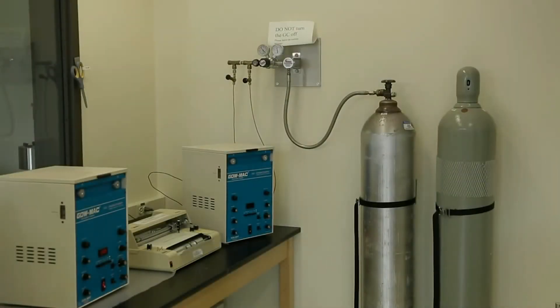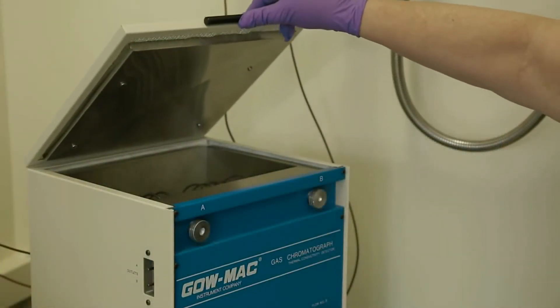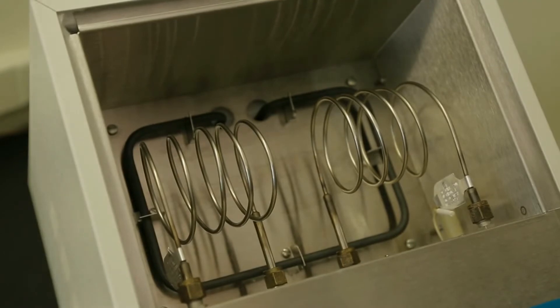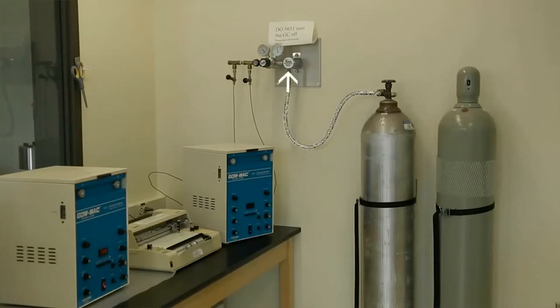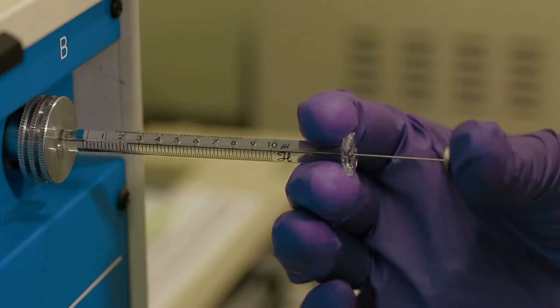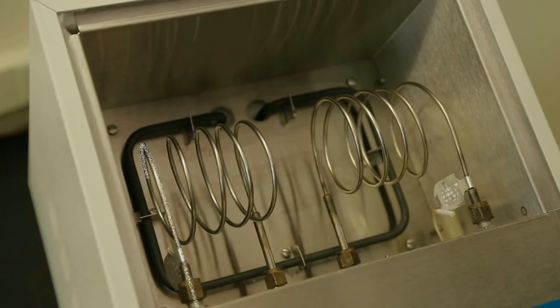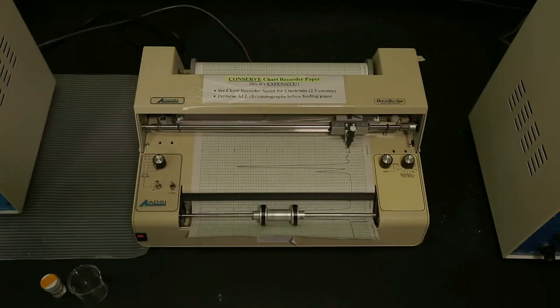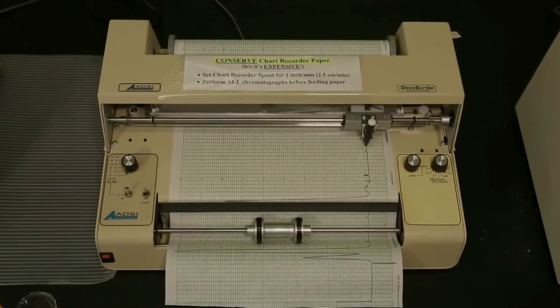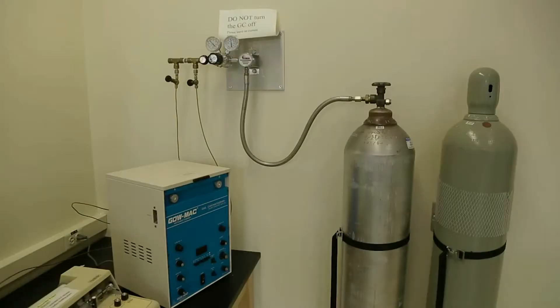To perform gas chromatography, often called GC, we use a gas chromatograph — an instrument with a long column filled with small particles coated with a very thin layer of an adsorbent. This layer is the stationary phase. Helium runs through the column and is the mobile phase. A sample injected into the gas chromatograph is instantly vaporized in a heated injection chamber so the components are in the gas phase and then flow through the column. The helium is the carrier for your sample. This technique allows us to separate volatile organic compounds based on their physical properties and determine relative amounts of product yields. Coupled with a computer library, GC can also be used to identify organic compounds.